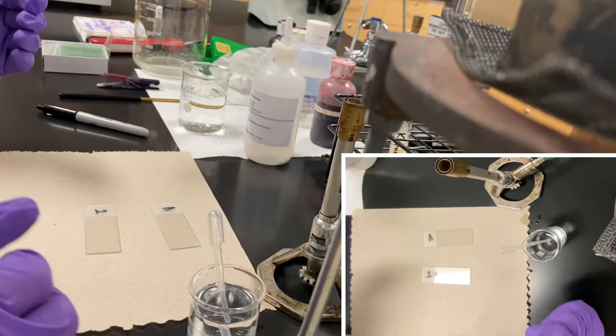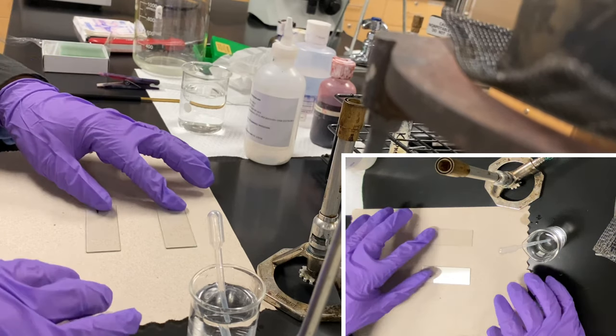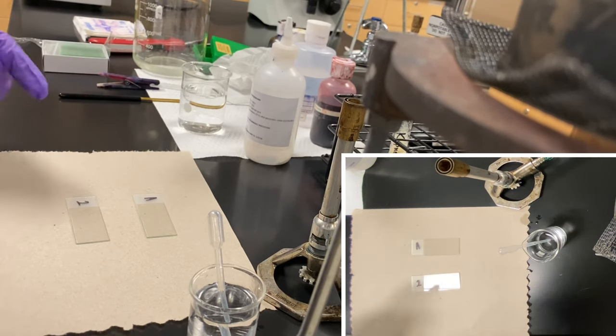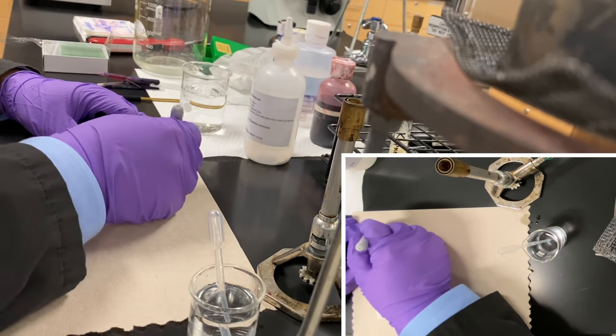Okay, so what we're going to do here is start setting up our first set of smears. Ideally what we want to do is set up our area. I'm going to use the slides we just previously cleaned and set this up so I know what's going in there.